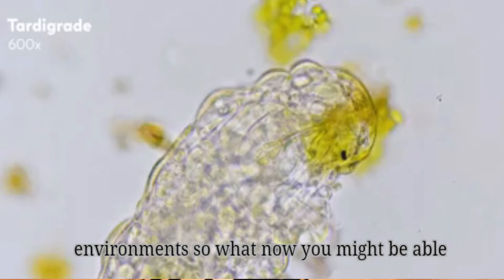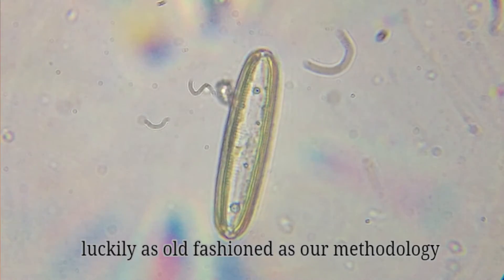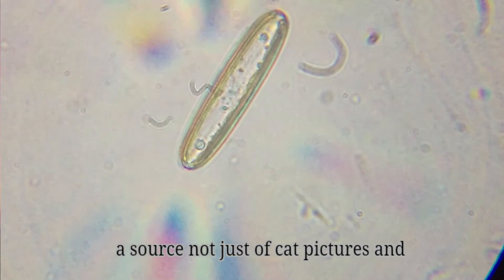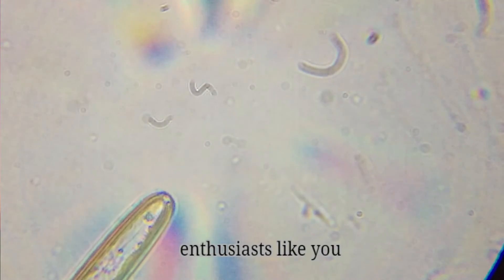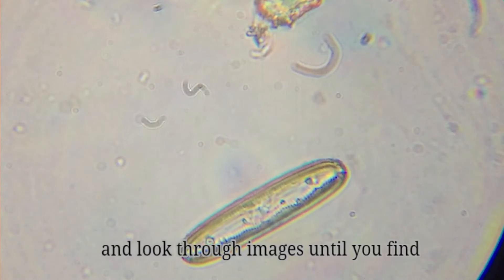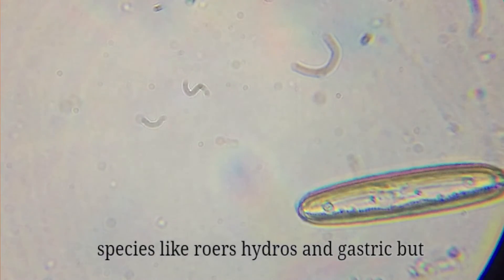Beyond what you see, there's also what you know. You know that you got this little guy from a pond — meaning a freshwater environment — so you can rule out organisms that only live in marine environments. You might be able to get help from a freshwater biology book, but if you're a hobbyist those books might not be worth the cost. Luckily, as old-fashioned as our methodology is, we have a resource that the microbe hunters of the past did not — the internet. A source not just of cat pictures and arguments, but also of the many microorganisms that scientists and science enthusiasts like yourself have studied and documented. Sometimes all you need is a simple search for something like "freshwater microscopic animal."